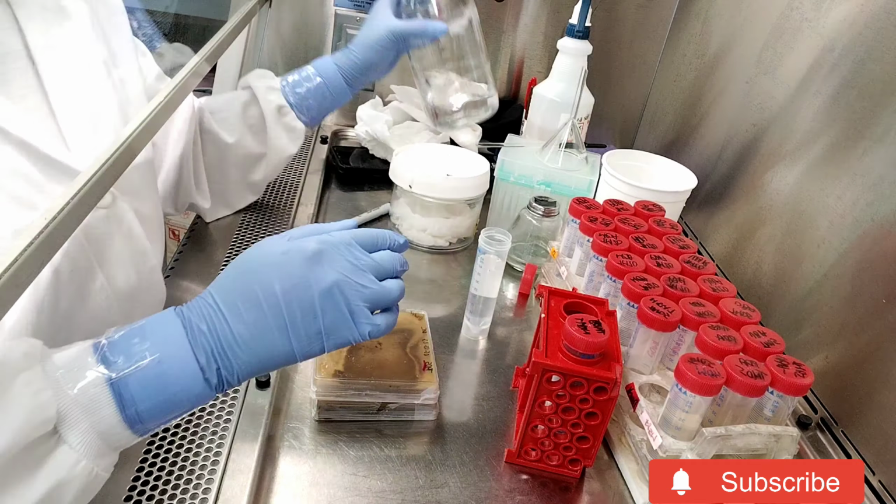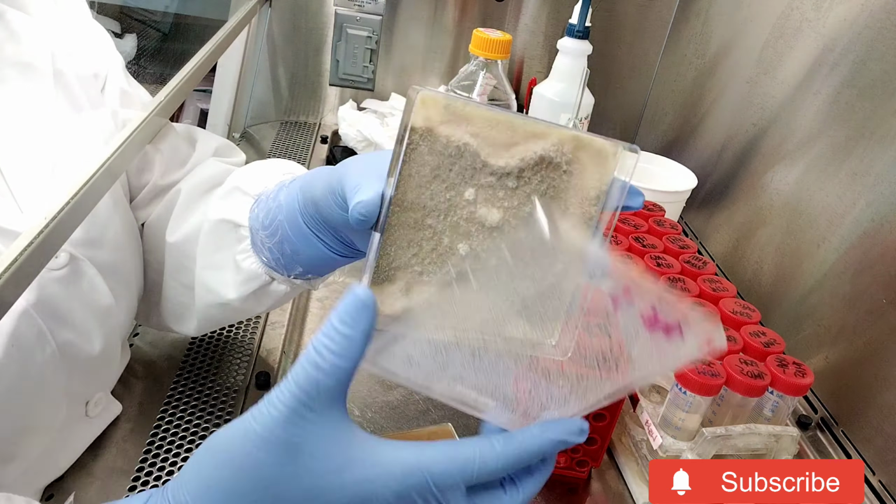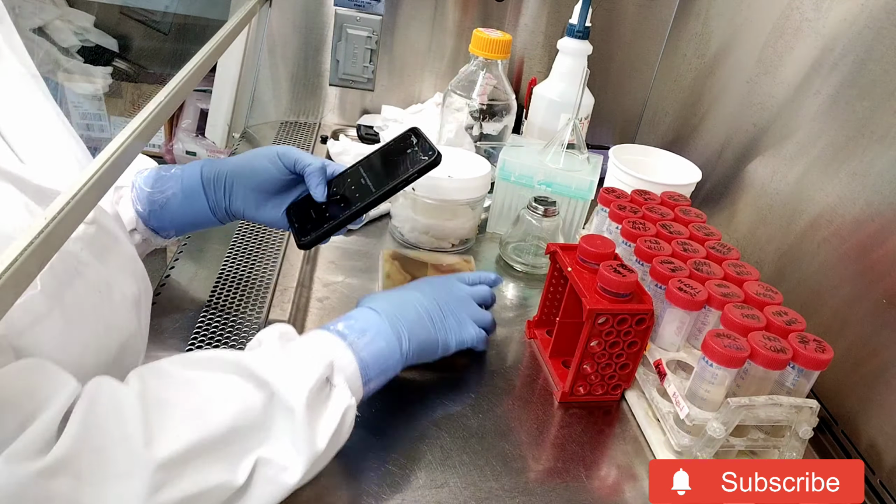So enjoy. In the next few clips, I will be going through the spore harvest process again because I have 3 sets.